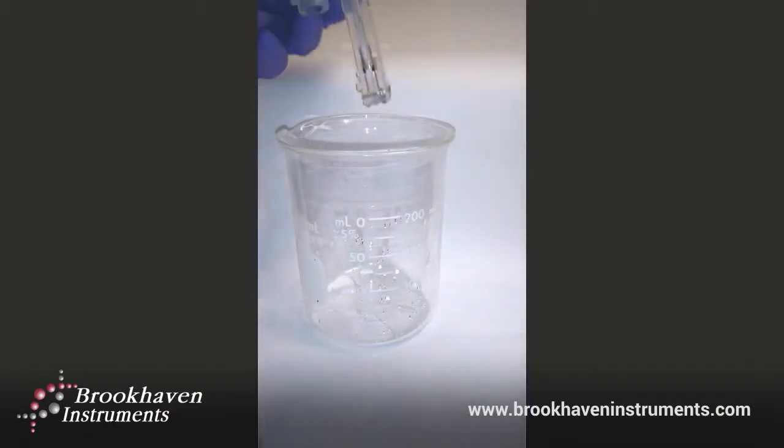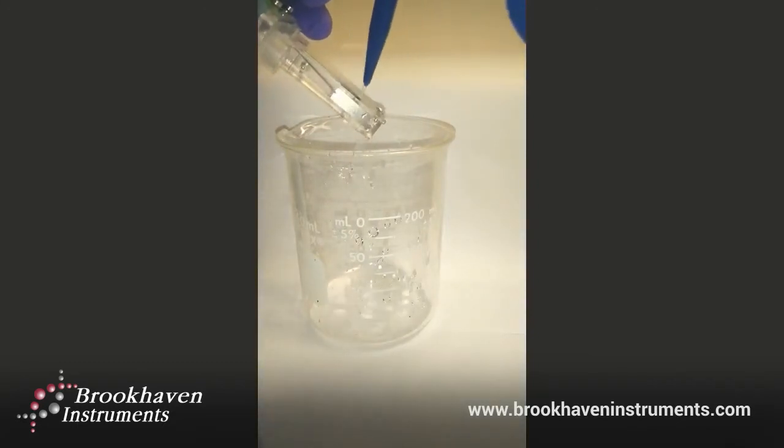And the electrode just needs to be thoroughly rinsed with deionized water prior to measuring another sample.